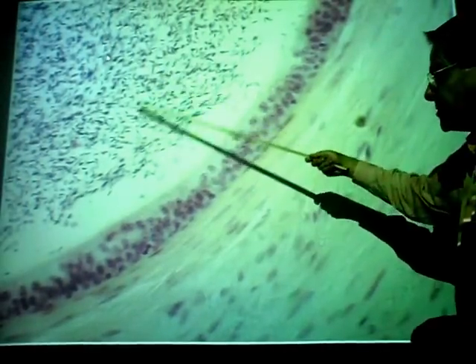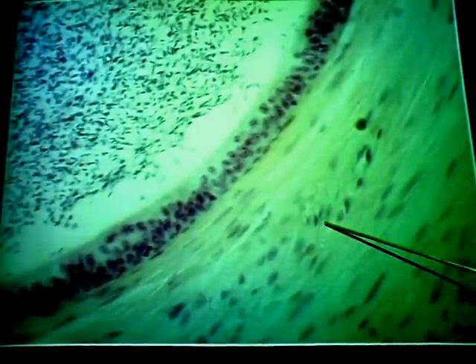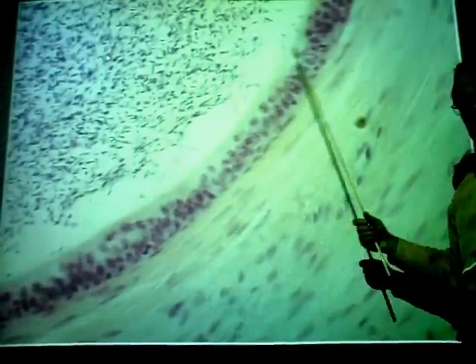And of course, these are the sperm cells. Millions. So this layer here is pseudostratified columnar epithelium, not ciliated. Unfortunately, these are called stereocilia. But they have nothing to do with movement. They remove excess water, and they provide nutrients for the sperm. So if I ask the function of these, don't put movement, all right? What moves the sperm is contraction of smooth muscle in the wall of this tube. Not these microvilli. Again, you call them microvilli or stereocilia, but not associated with movement.